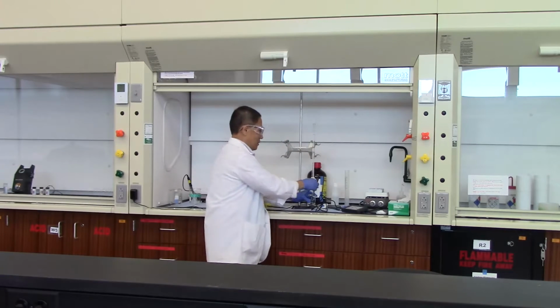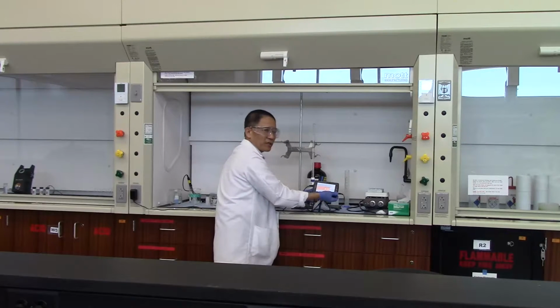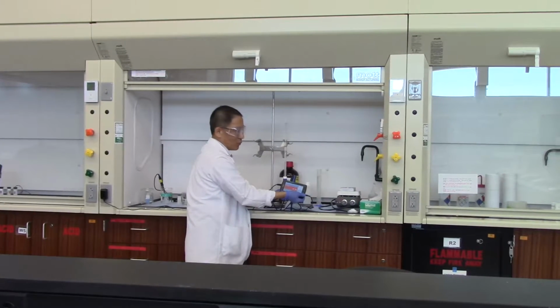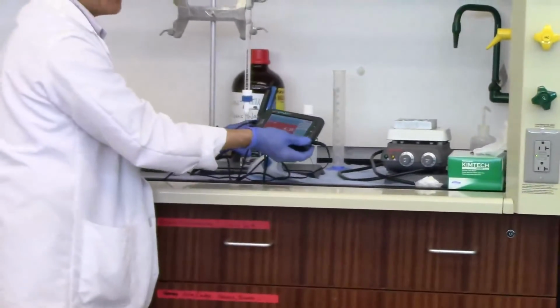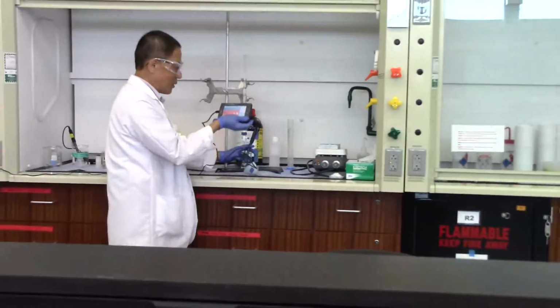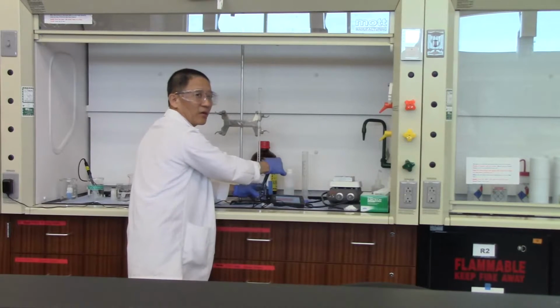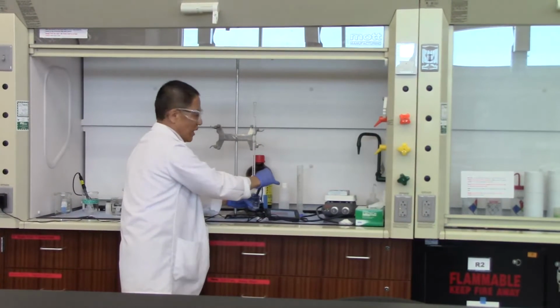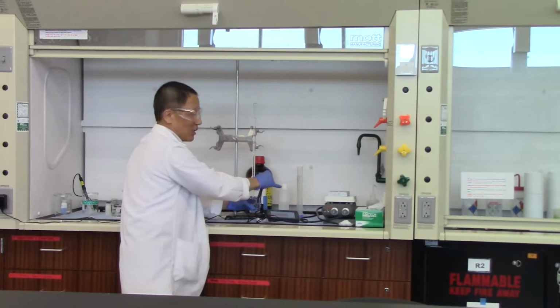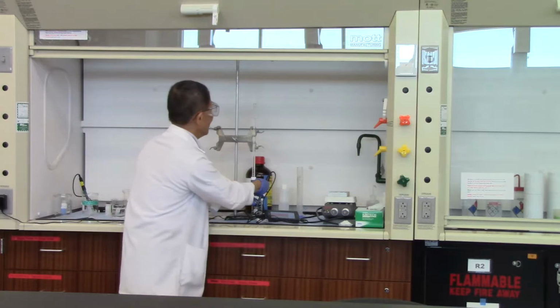We will just put one milliliter in there. Okay? And then when you stir it, you see the pH start to change a little bit, but not by much. It was 4.05, and now it's 4.35. So the pH did go up a little bit, and it shouldn't really go up this much. It could be because I haven't done a thorough mixing yet. So by mixing the solution with the glass rod, you can see the pH stabilize a little bit. So we added 1 milliliter of sodium hydroxide, and the pH didn't jump much, and we can put another milliliter in there.